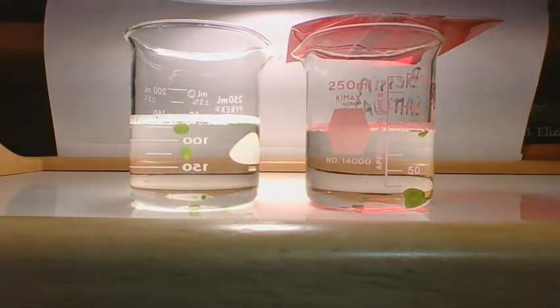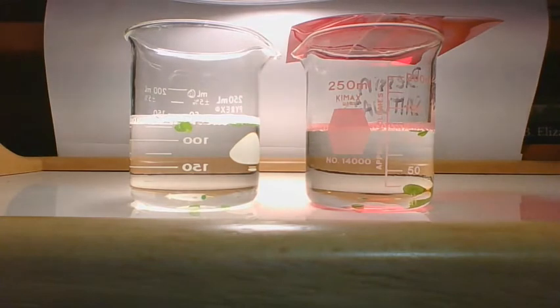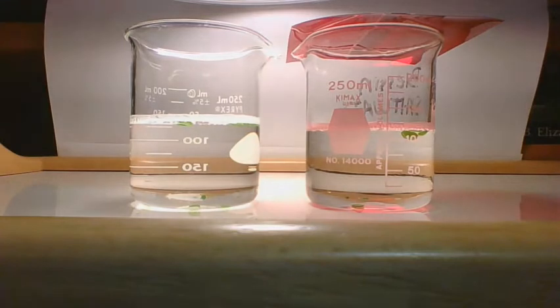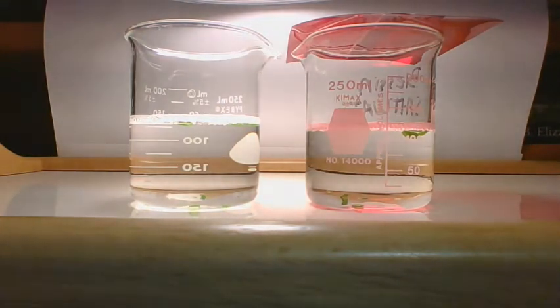So I just look at the top, because you have to graph this and you want to see it going up, right? We're at 6:40 right now. This is just proof that photosynthesis does not take very long, because they've started to float, which means they're making oxygen, which means they're doing photosynthesis. Okay, in the white light, we now have five on top, and in the red light, we have three.